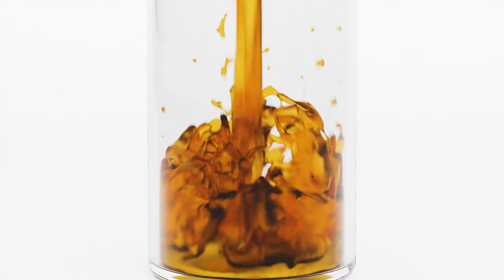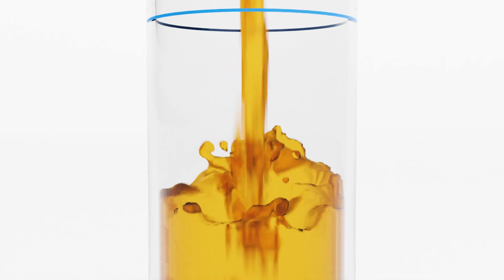A cloud point test is similar to the pour point test. A cloud point uses a test jar with a mirrored finish at the bottom. Fill the cleaned and dry test jar with the sample up to the mark. Remember that the bottom of the meniscus should be leveled with the mark.